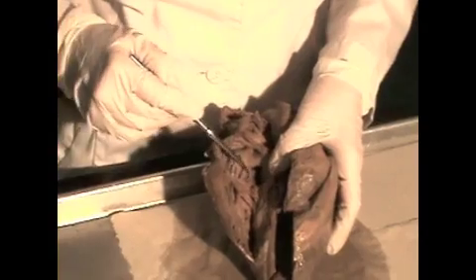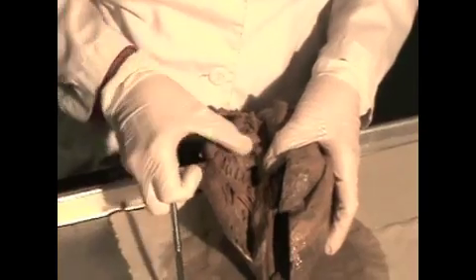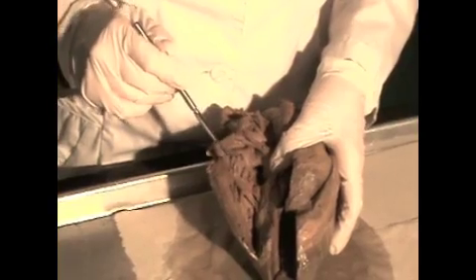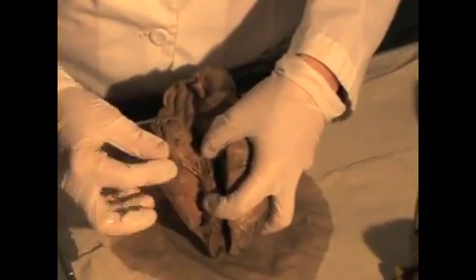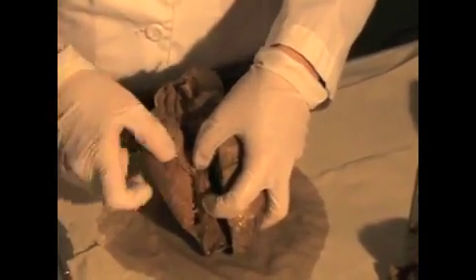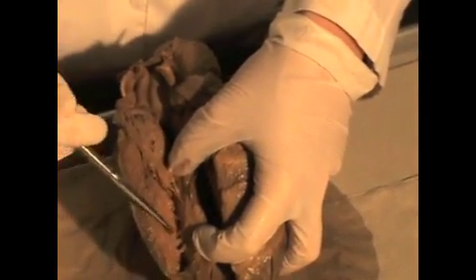Inside the atrium, you can see these muscle bundles in here. This is called pectinate muscle. And so pectinate muscle characterizes the appearance of the inside of the atria. This is the right ventricle. And when you look near the apex, you see kind of an arrangement of muscle down here near the apex.